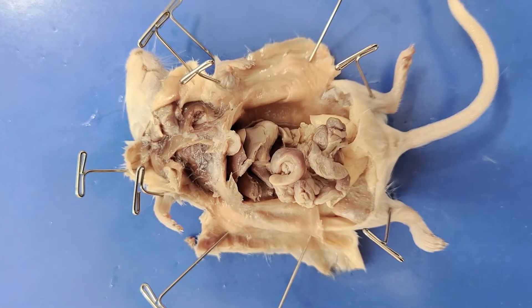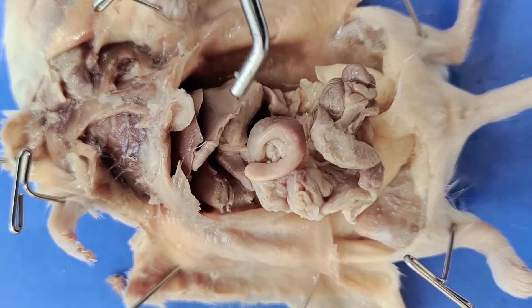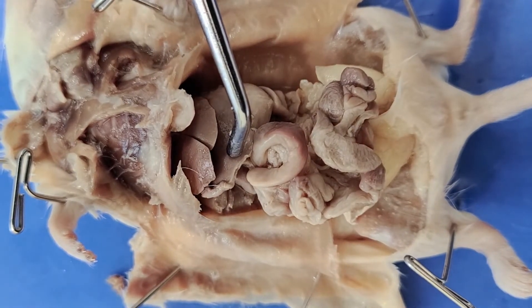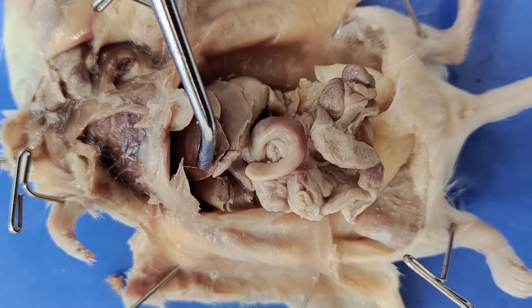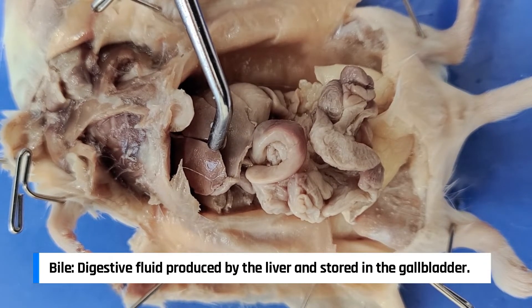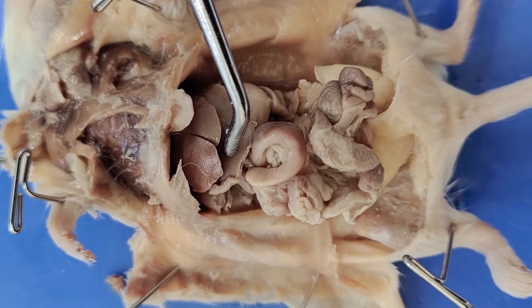Let's take a look at the abdominal cavity. The liver, right here up top, is the largest organ in the abdominal cavity. You can see that there are several lobes — a total of four lobes. The liver is a jack of all trades, performing several important functions in mice and in humans. Liver disease can be so deadly because the liver's functions are so complex that nobody's been able to invent an artificial substitute, and liver failure can be fatal in days. The liver's main functions are to filter and detoxify blood, make proteins, store energy, and produce bile. Bile is used to digest lipids — think of scrubbing a very oily plate: the water will just wash right off unless you have some soap to break up the oil. Bile works similarly in the digestive process, breaking up lipids so that they can be absorbed.